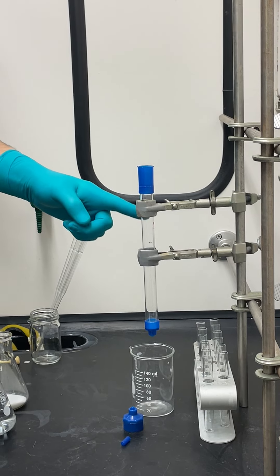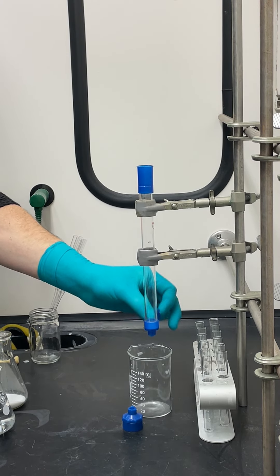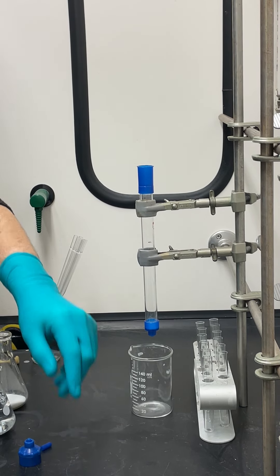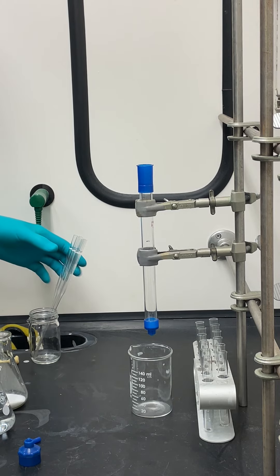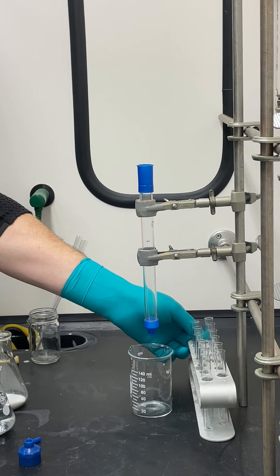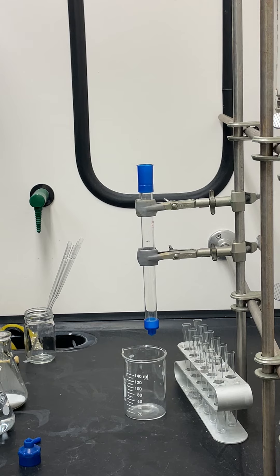The first thing you want to do — these are the columns you're going to use. They're glass, with a little plastic nozzle at the bottom. Each comes with a plug for the bottom and a cap with a little hole that fits on top. Clamp the column twice so it's perfectly straight up and down. Get a couple pipettes — don't put them on the bench top; keep them in a beaker to stay clean. You'll also need Erlenmeyer flasks, test tubes, a test tube rack for collecting fractions, silica, sand, and a squirt bottle.